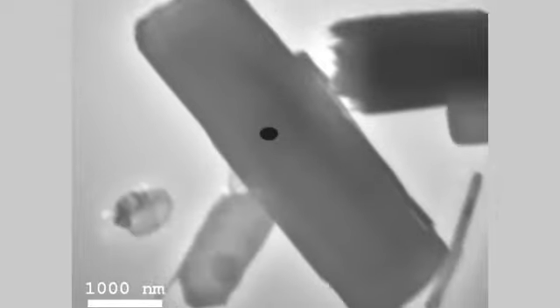So now we have a magnification of 4000. And the small pieces you see in the middle of the screen, that is the molybdenum trioxide crystals. So now I switch to the camera view, which you will see on the screen now. So the green has now become gray. And the black region here is the sample that's being observed. So this is the molybdenum trioxide crystal viewed in the TEM camera. What we have here is 4000 in magnification. And you can see with the scale bar on the screen that the width of this is almost 2 micrometers.